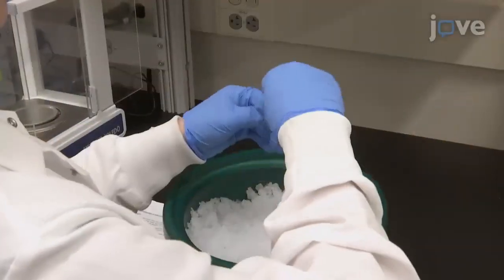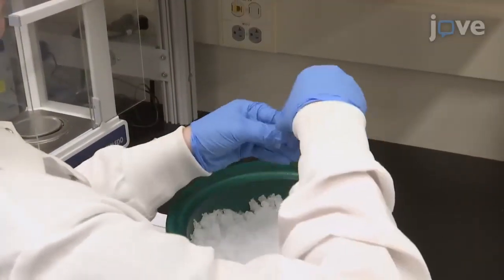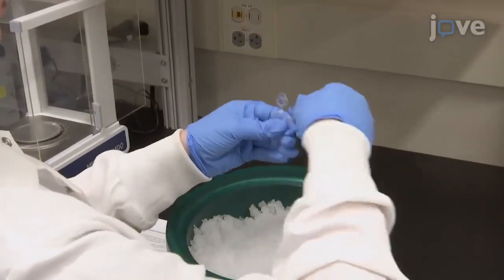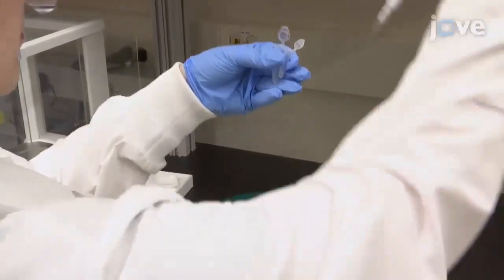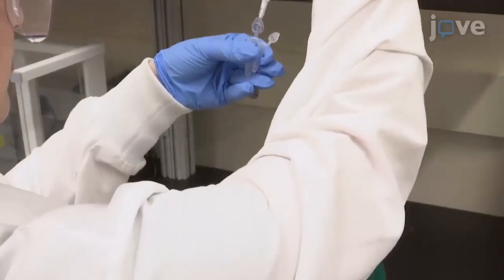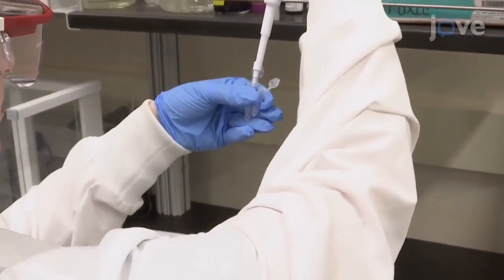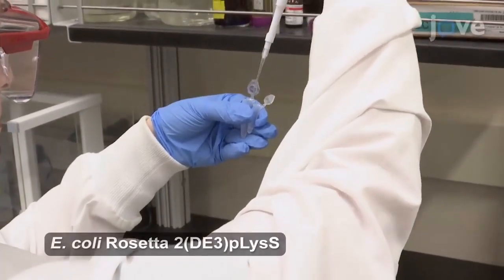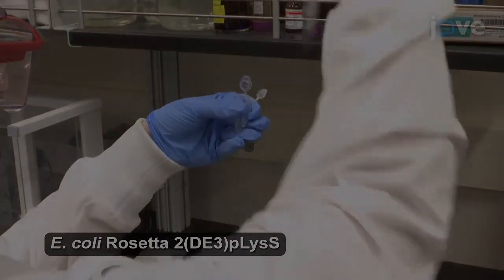Start the protein expression by preparing a pre-culture. Following the manufacturer's instructions, transform 1 µL of the expression plasmid into 50 µL of E. coli competent cells.